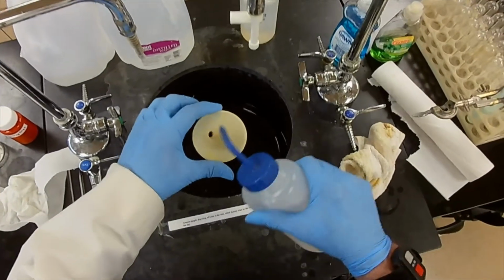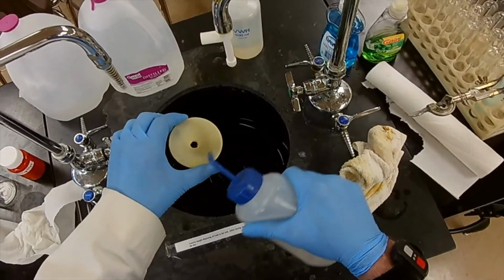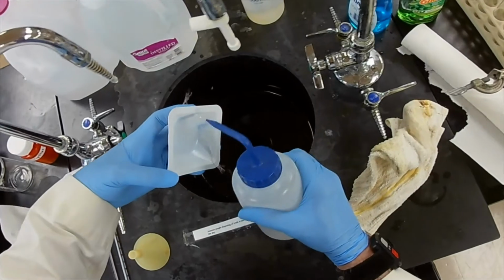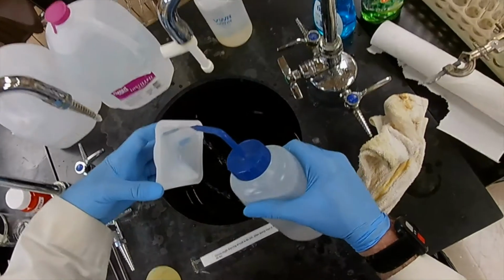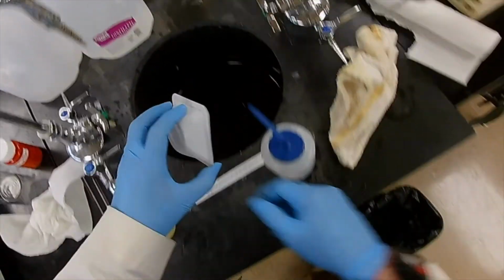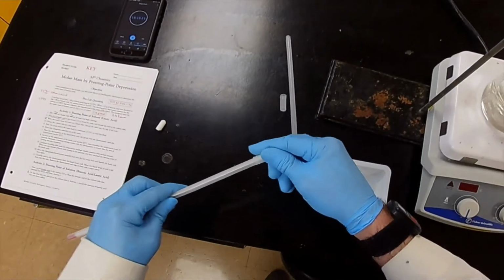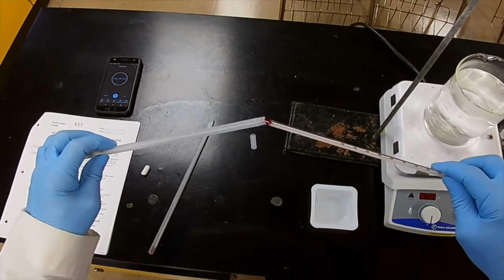And while it's doing that, we'll rinse out our utensils so we can use them later on something else. Of course, this one is going in the trash. This one has been cleaned, and it's... no, it hasn't been cleaned. I remember we left that for later. There we go. Save that one. The thermometers can be returned to their buckets. I got one from one bucket and one from the other bucket. So we return those to their place.